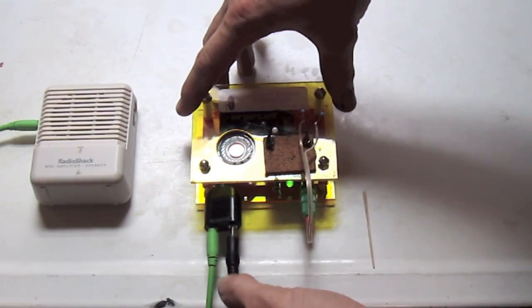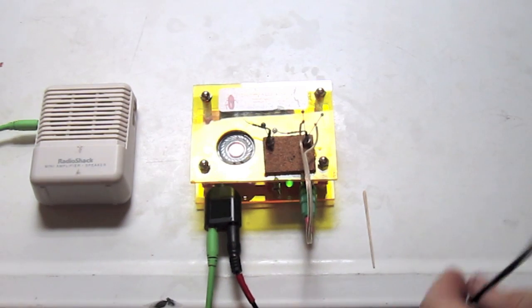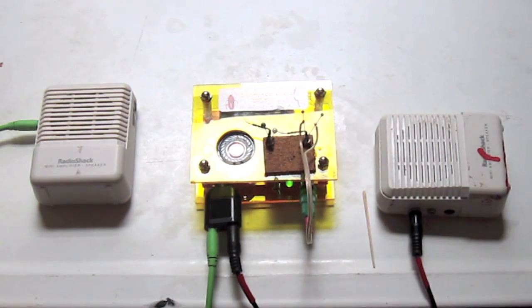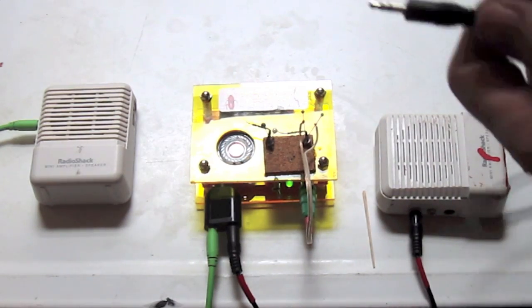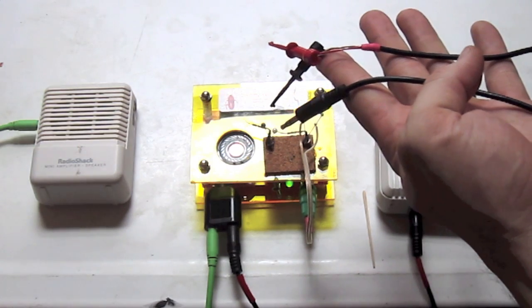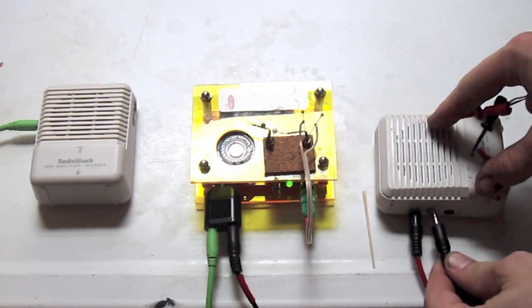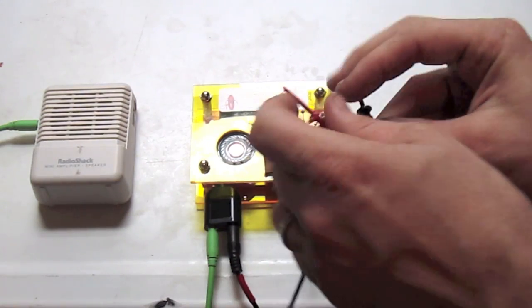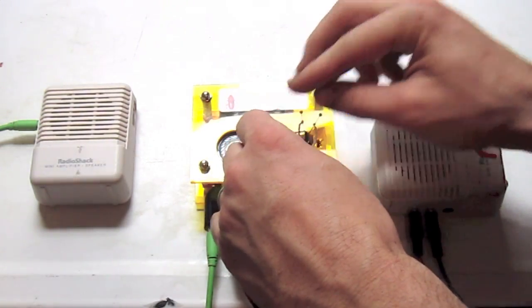Now, for reasons that are still strange to me, we cannot directly hook up the spiker box to the secondary cockroach leg. The spiker box can only output about one volt max, and we need to increase it to about two volts before we can elicit muscle movement. Therefore, the other half of the Y-splitter is going to a secondary amplifier that is then outputting to our stimulation cable that is plugged into needles placed into the secondary cockroach leg.